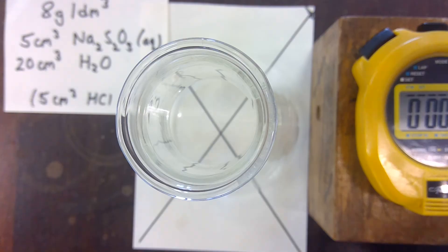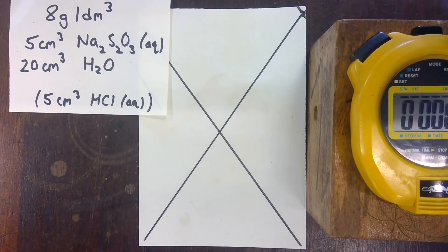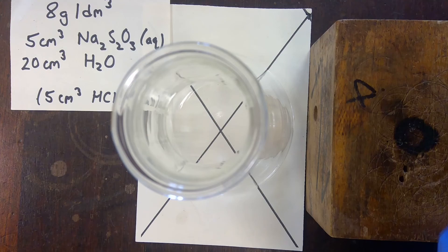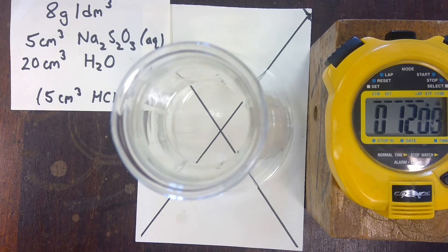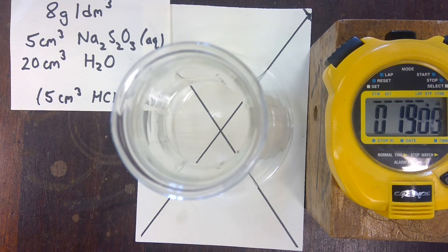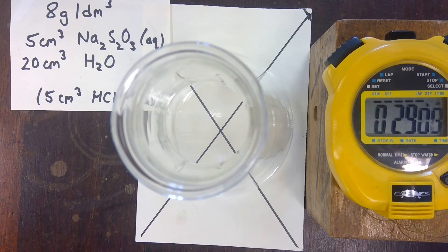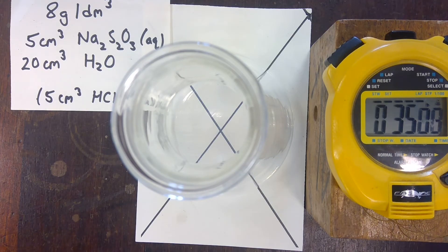Same instructions as before. We'd anticipate this one being the longest of the experiments. When we have finished, we will take the value in seconds — not in minutes and seconds, but in seconds — and we will look at the rate of reaction as being 1 over the time taken in seconds, and see if there is a simple relationship between the concentration and the rate of reaction when expressed as 1 over the time taken.